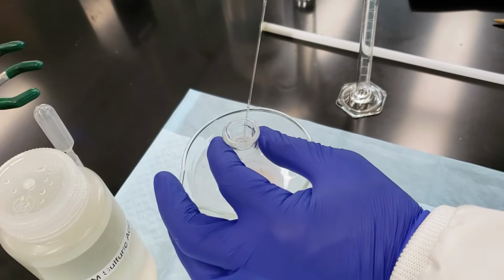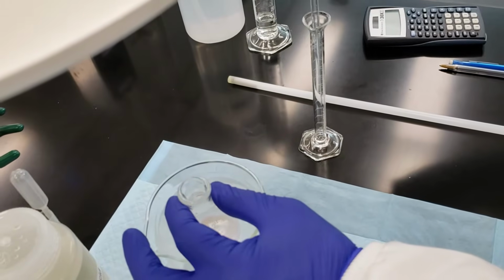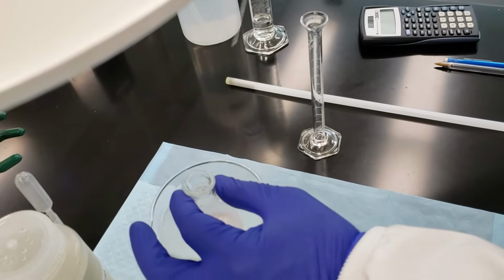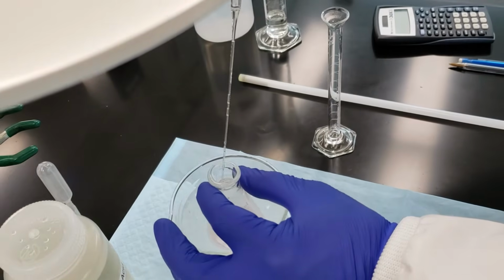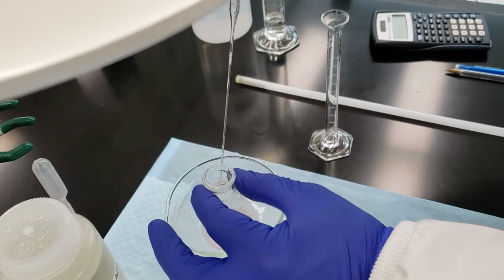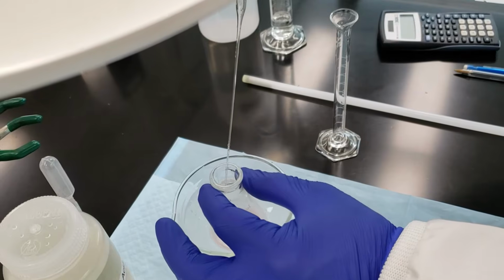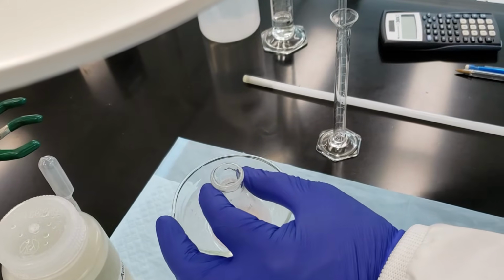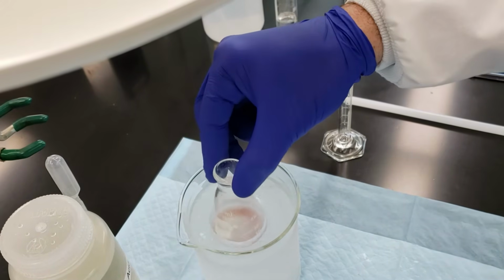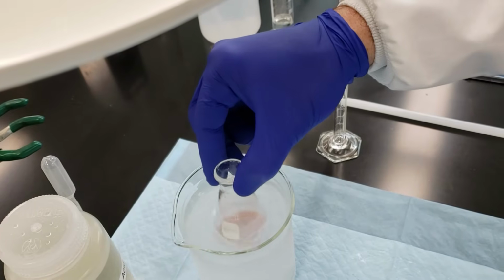Last couple of drops, and then we're done. Oh, no, we got a little bit left. Got to make sure we get everything. We had 1.5 mL. I want to make sure we get it all in there. But we've added it slowly enough that I haven't felt any real temperature change here. It's nice and cool. Swirl it a little bit more in our ice bath.